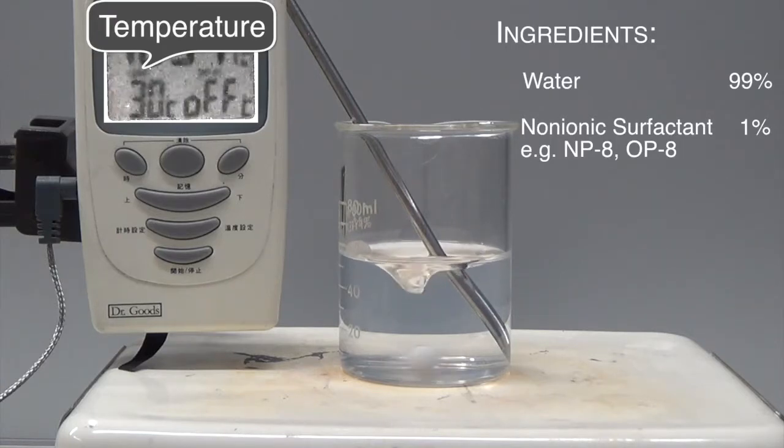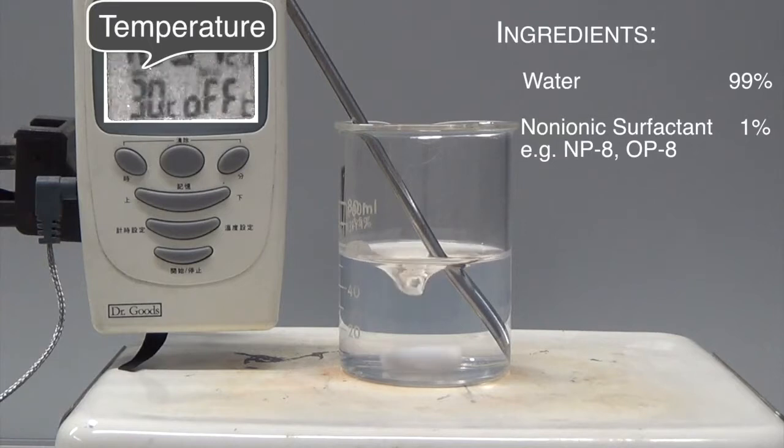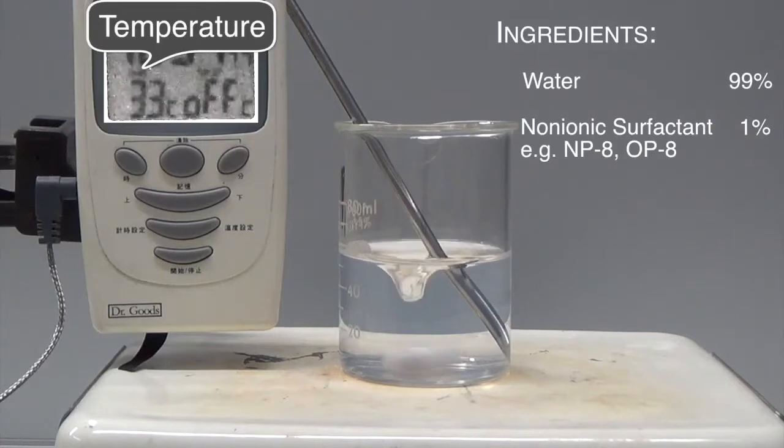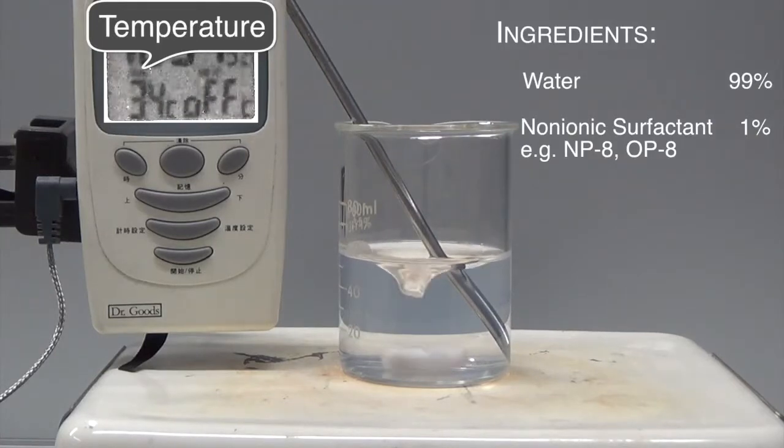At room temperature, the solution looks clear. However, as the temperature rises, the solution becomes more and more cloudy.